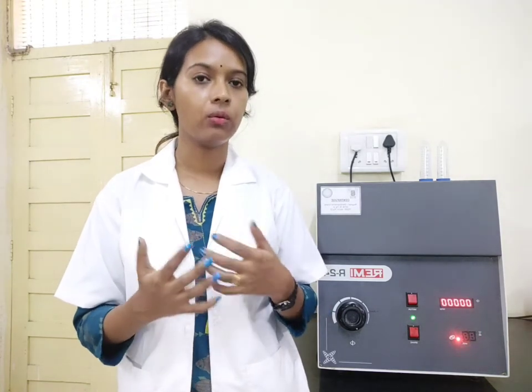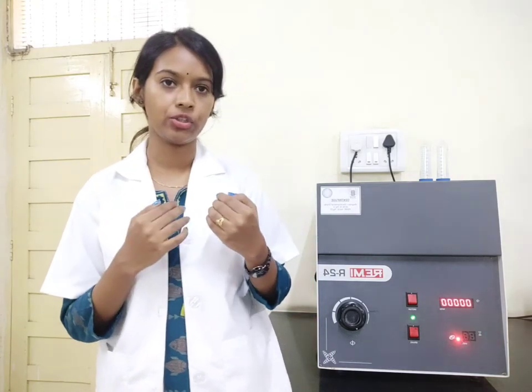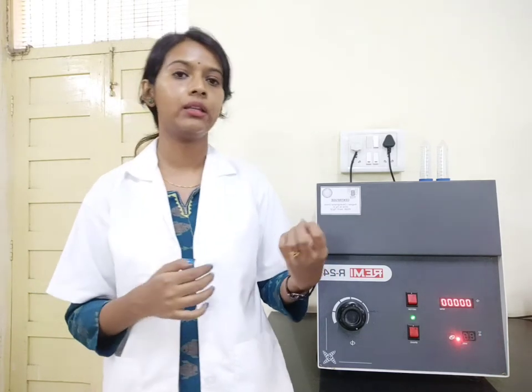The reason why this sedimentation or separation occurs is because of centrifugal force. Inside the instrument there is a rotor which rotates at very high speed. Depending on the centrifugal force, the heavier particles will move towards the outward direction and then sedimentation takes place. As it rotates, particles move outward and then sediment at the bottom part — that is how you receive the pellet and can separate it out.